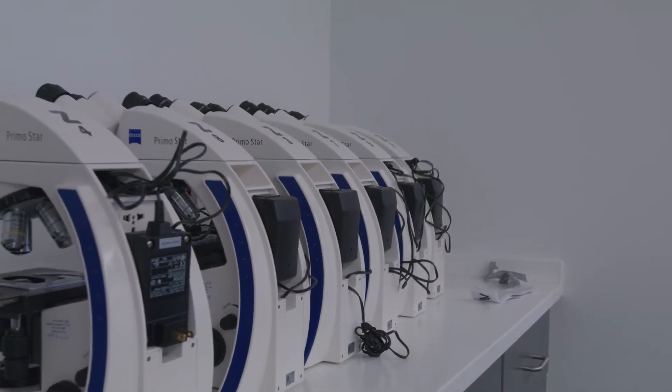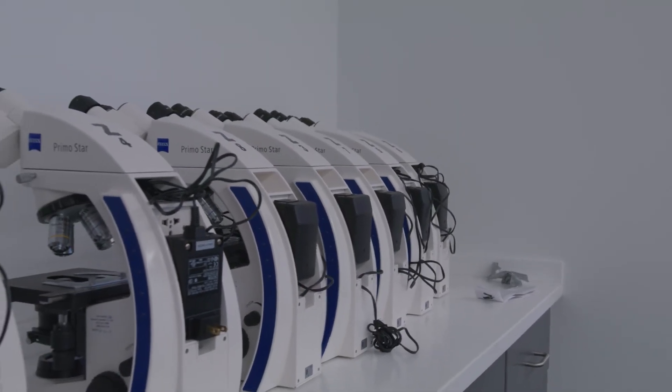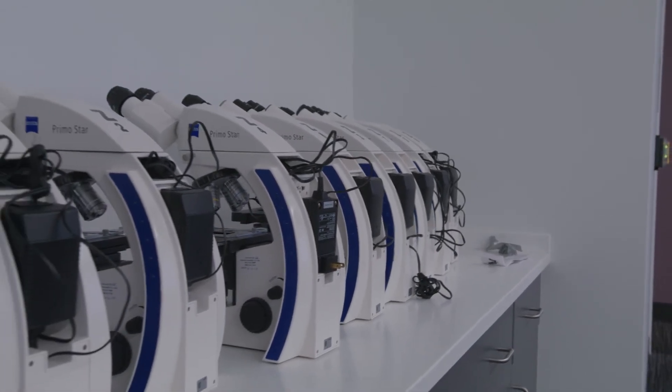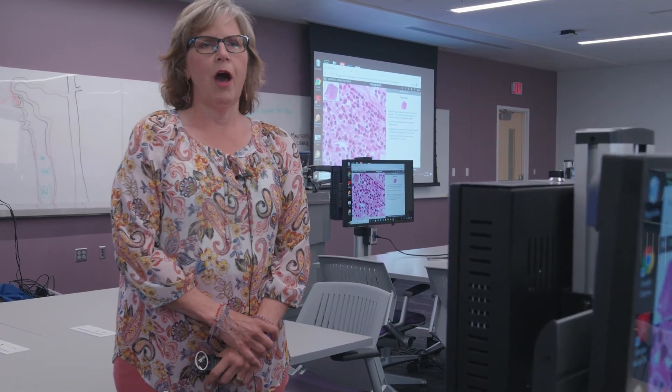We have microscopes that students basically borrow for a semester, so we have microscope storage here. This room is another space that students have 24/7 access to — they can come in any time using their badge, and we can program which classes of students can get in here. So I often see them in here after hours.